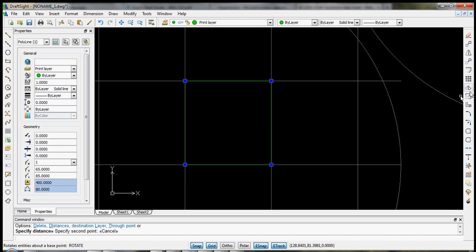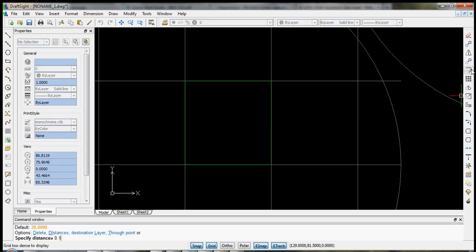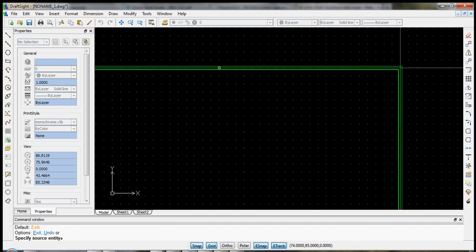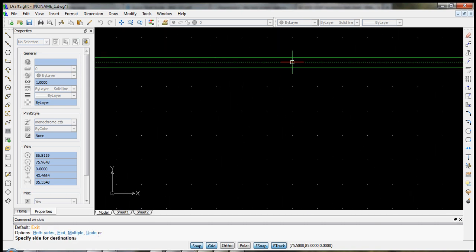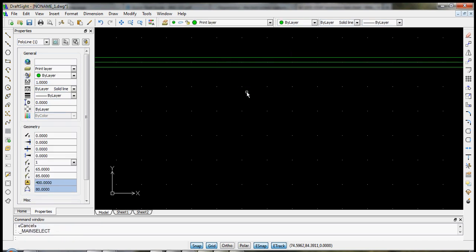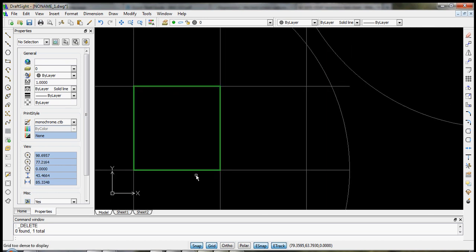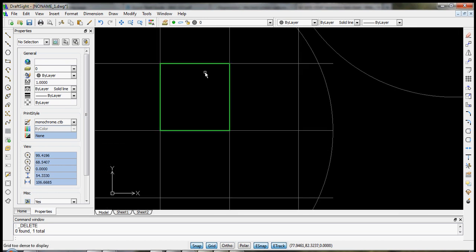We will select our distance to be 0.1 millimeters. We'll select our print square and both sides, and we zoom in closely, and then select the middle one. Actually, we're done with offset. We'll select the middle one, and now we will delete it. So now we only have printed a 200 micron wide square.